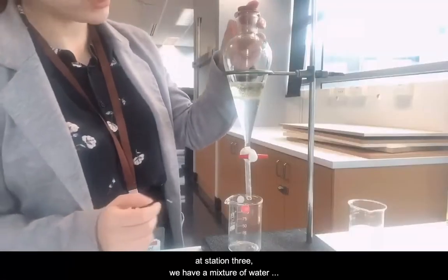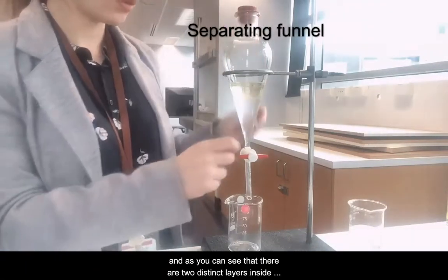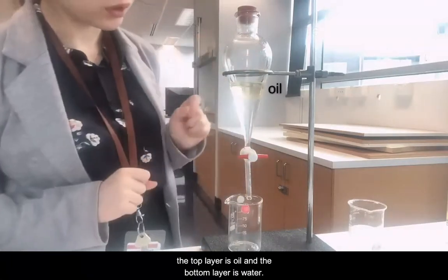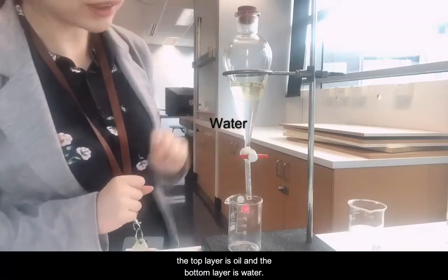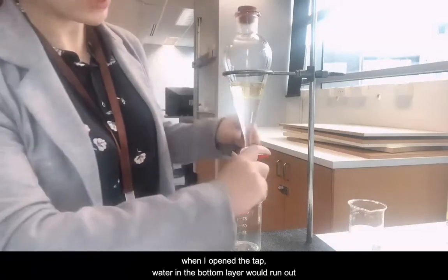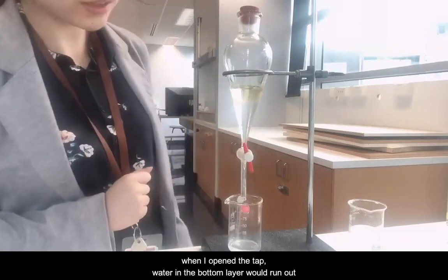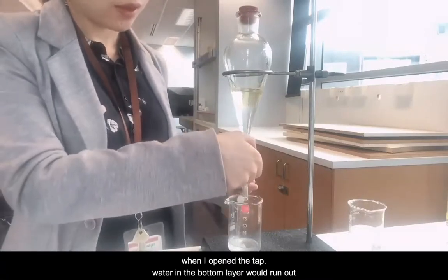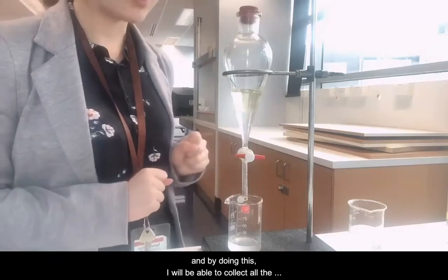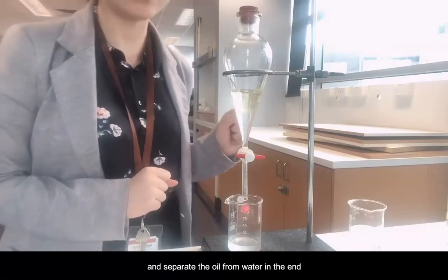At station 3, we have a mixture of water and oil in the separating funnel. And as you can see, there are two distinct layers inside the separating funnel. The top layer is oil and the bottom layer is water. Why does oil stay on top? When I open the tap, water in the bottom layer will run out. And by doing this, I will be able to collect all the water in the mixture and separate the oil from water in the end.